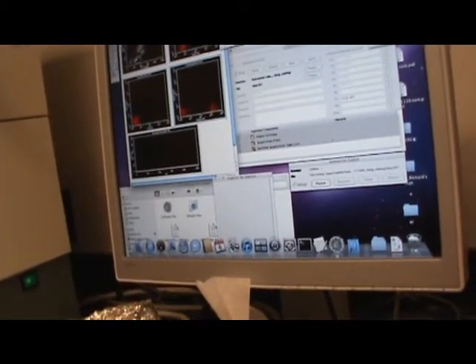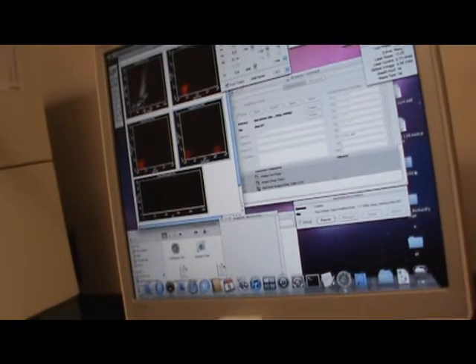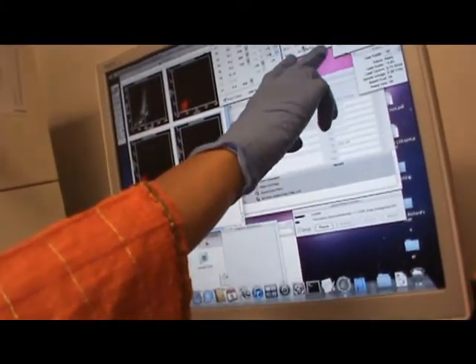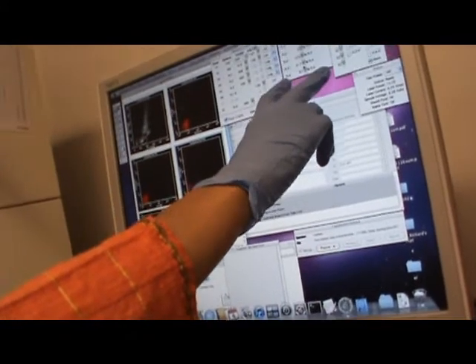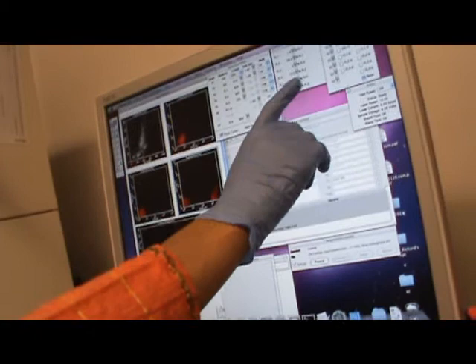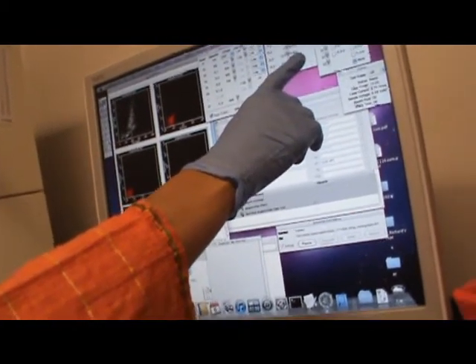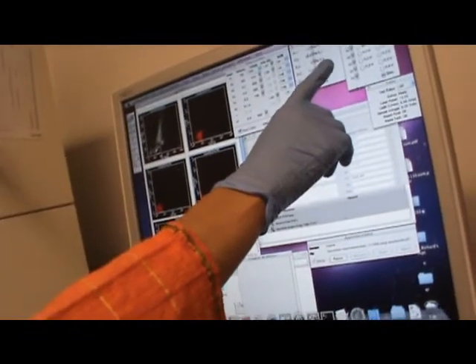I just tried different ways to show you that if you have 4 different colors, 3 different colors, how should you be concerned? There's nothing that you have to memorize here, because it is just showing you which two parameters you should work on. FL4, FL3, APC and per-CP. Per-CP and FL2, which is PE. Generally that is 0, because PE and per-CP, not much of a problem, unless the antibody is different.